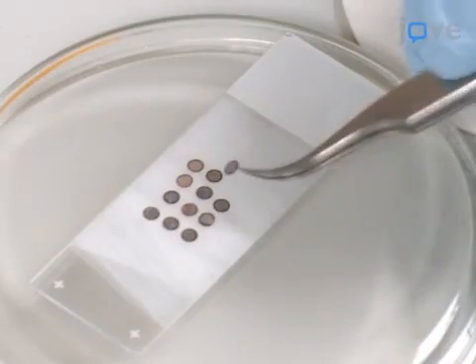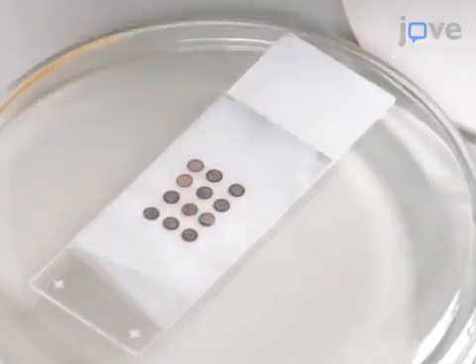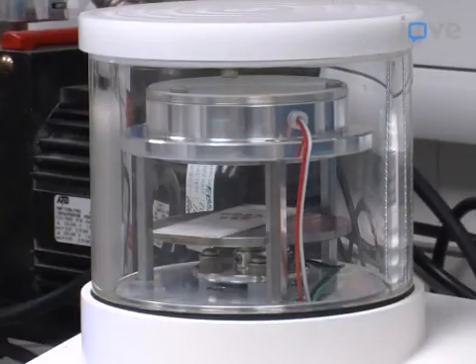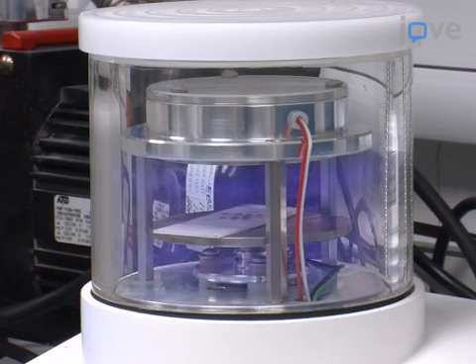Place a carbon sheet coated EM grid facing up on a microscope slide. Set the slide into a glow discharge unit and treat the grid for a minimum of 30 seconds at 10 milliamps to render the grid hydrophilic.